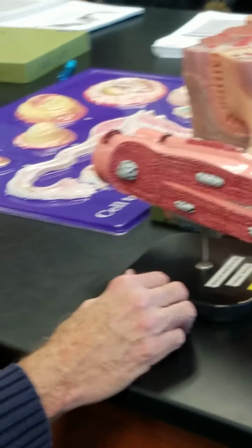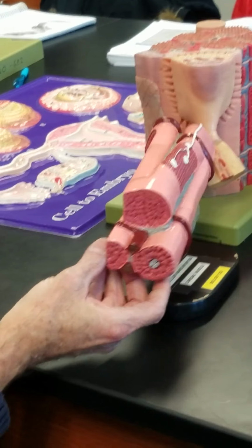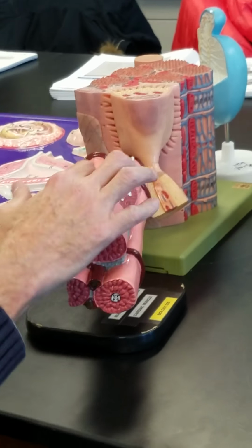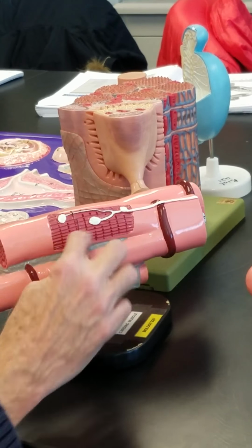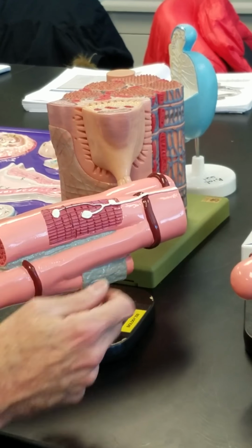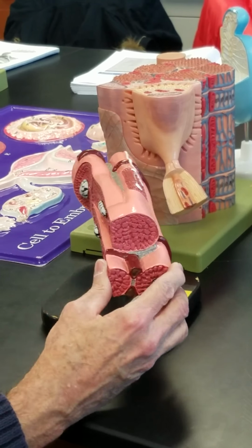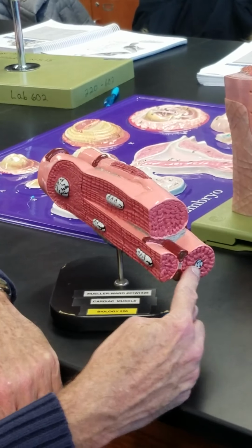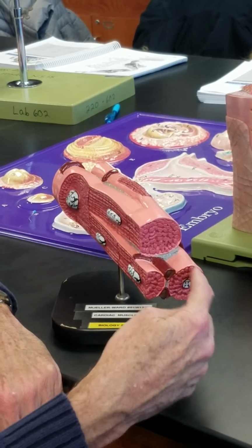Very, very small fascicle of cardiac myofibers or muscle cells here. Looks like 1, 2, 3 of them here. What's this gray in between the cardiac cells? Endomysium connective tissue. And the cross-sectional view reveals a couple of things. A central nucleus, deep nucleus in there, and we can see myofibrils.